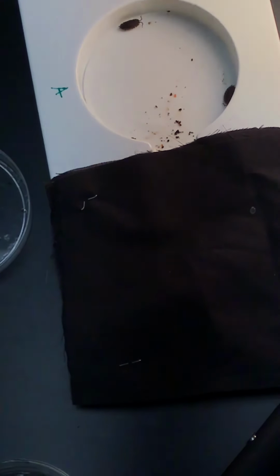Okay. So I just reset the timer. We'll see if any of them move now. So at this point, we have 1 that's still kind of up against the edge of the behavior chamber, and the other one is on the side closer to the edge of the behavior chamber. And I don't know if you can see, but he's absolutely pulsing the posterior end of his body.